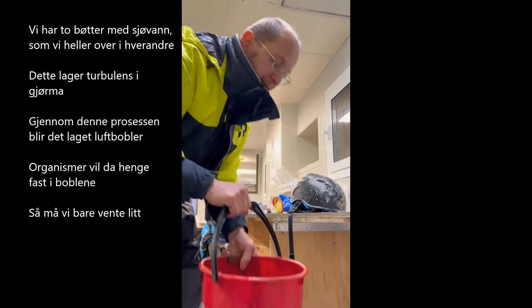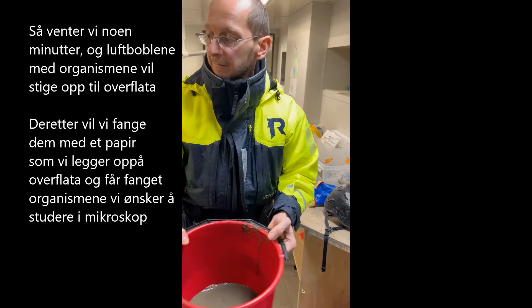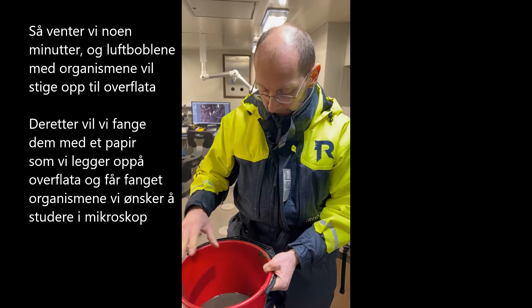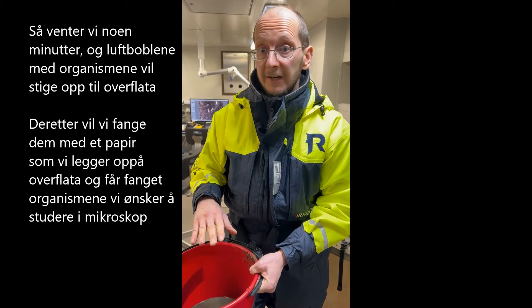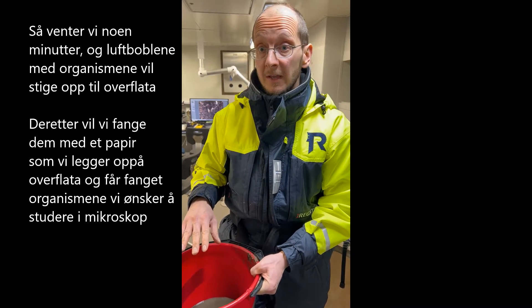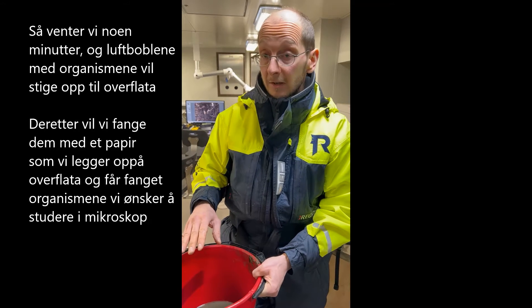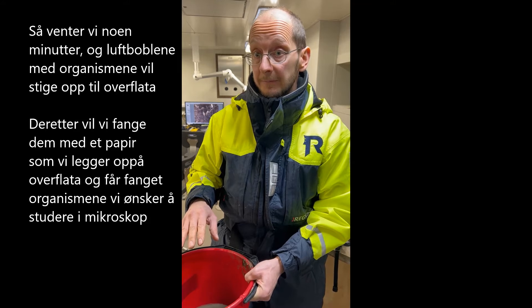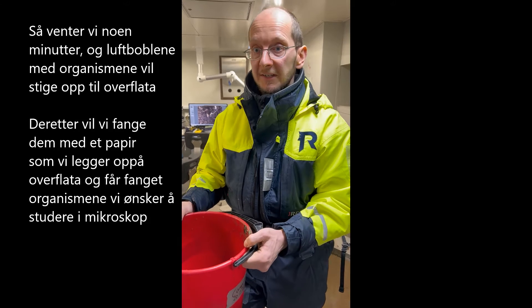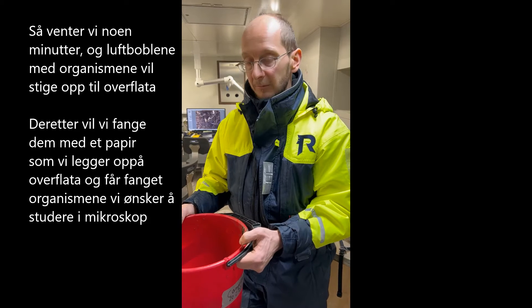Now we put it over here and wait a few minutes. All the air will come to the surface and bring the small organisms up — they will be attached to the air bubbles. Then we take the foam with a piece of paper and get our organisms into a small filter net, and then we'll look at them under the microscope.